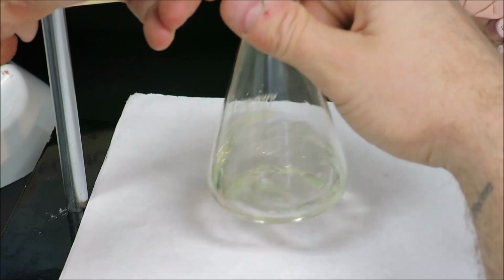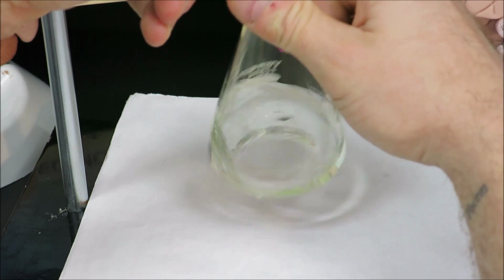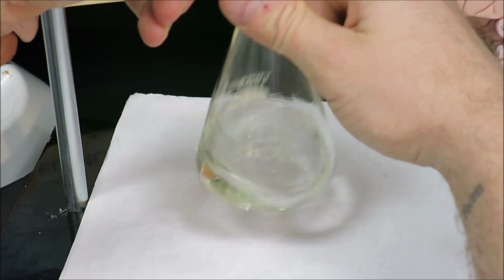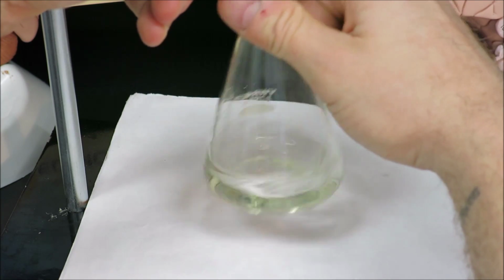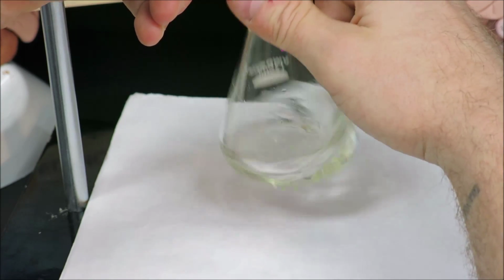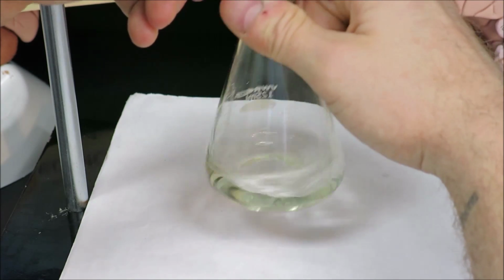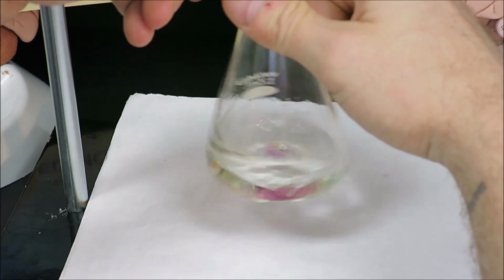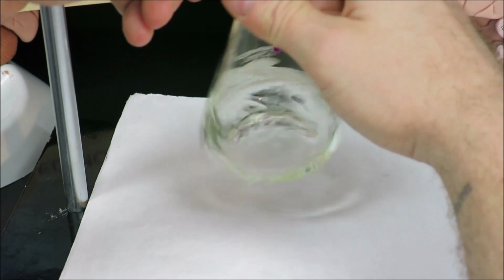And if we get a little closer, we'll try to actually stop it on a half a drop, just to demonstrate the idea that it does not take a lot of titrant to change the solution color once we get to the equivalence point. So I am dripping this very slowly, like I said, trying to aim for maybe being able to add a half a drop to reach the endpoint color that we need. One more drop.